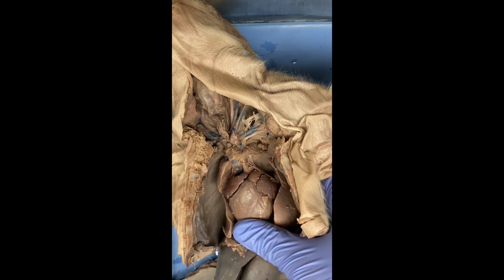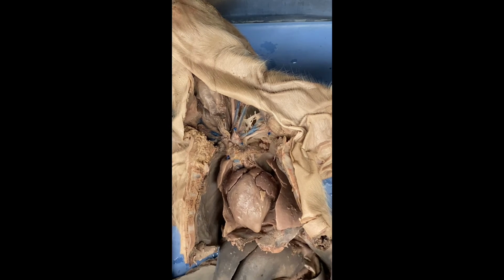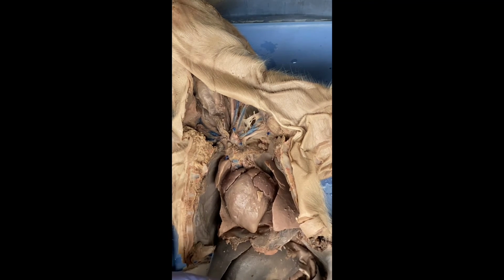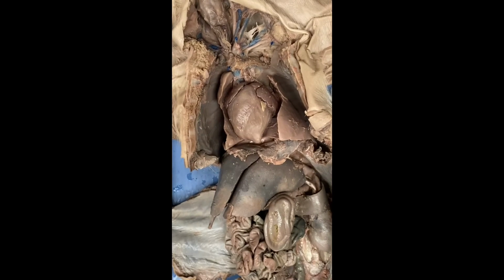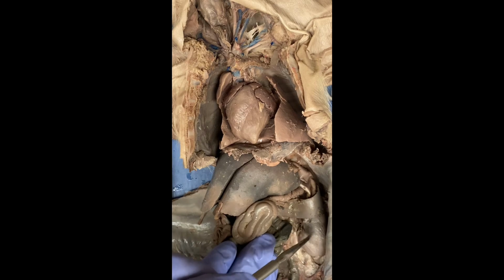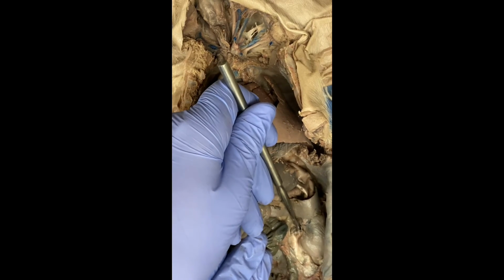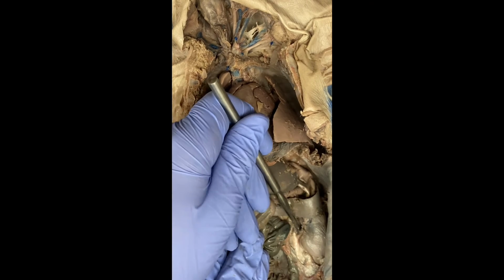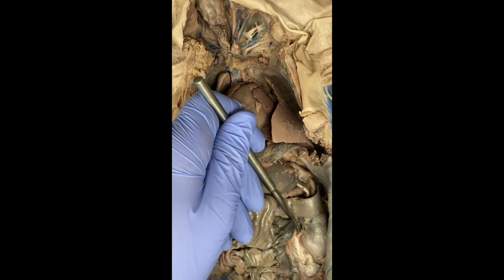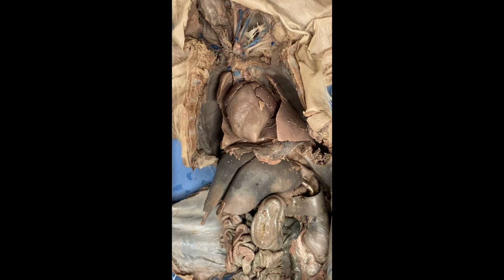The renal artery, also known as the artery for the kidney, is going to be found down here. Right here, let me scooch her up a little bit. There we go. So this is our kidney, which I have kind of dislocated from everything. And right here, this little red bit, that is the renal artery. And the point of the renal artery is it brings the blood to the kidney. So there's going to be one on each kidney.